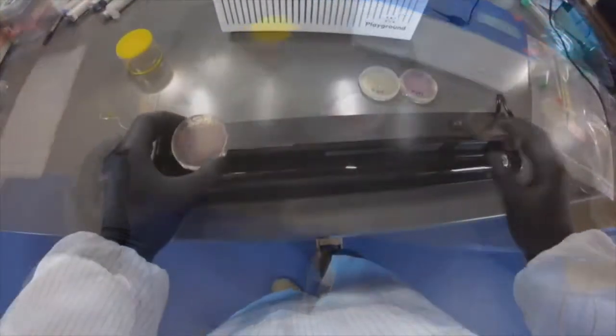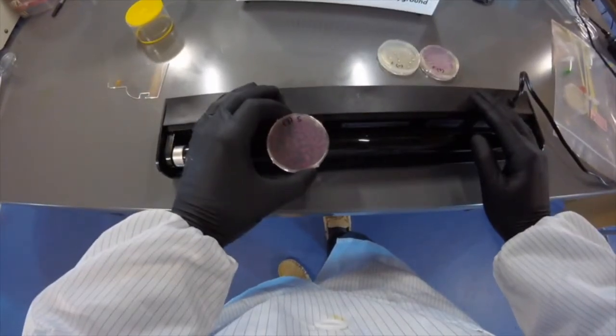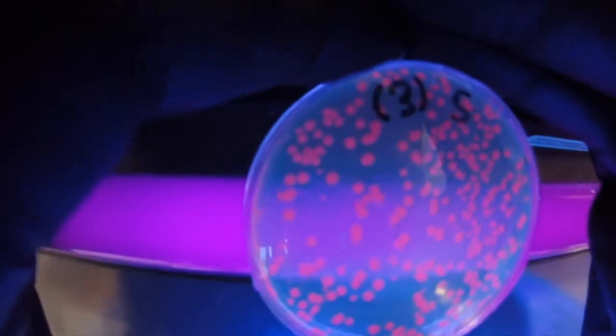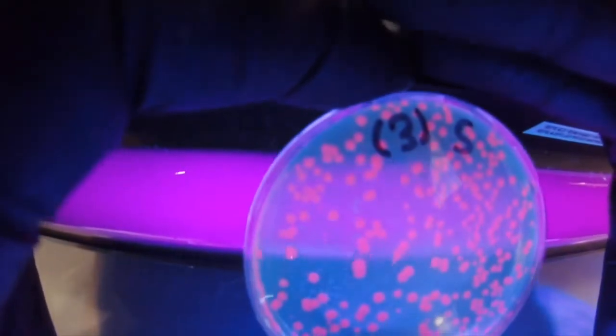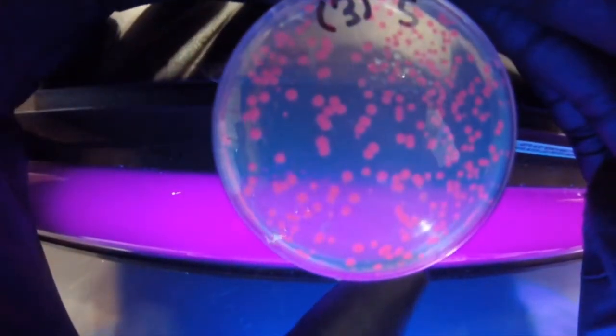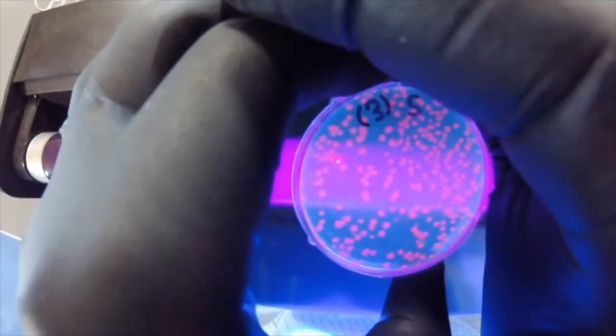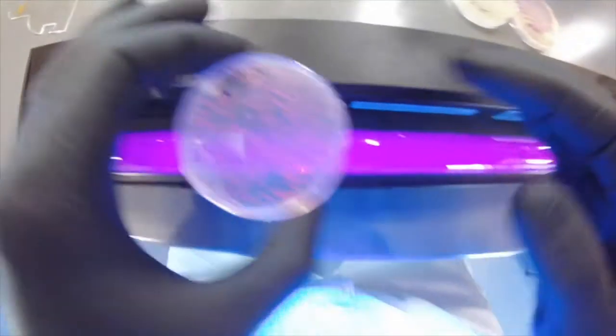There you go! Oh yeah, you can definitely see—look at that fluorescing bacteria! Great, so at nighttime these are going to pop under a black light, which is great.